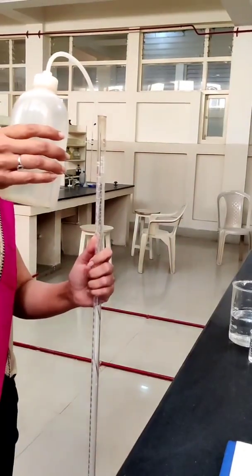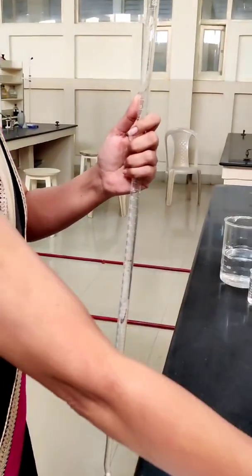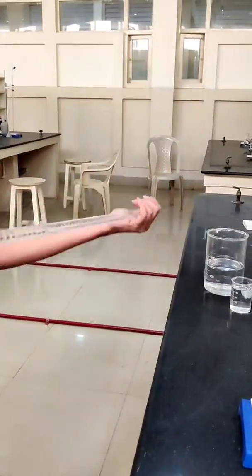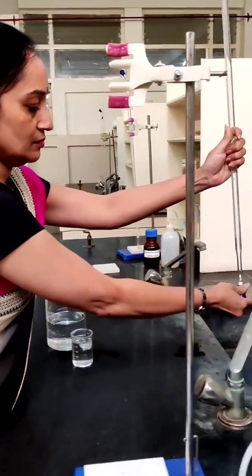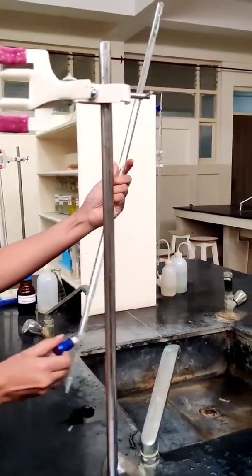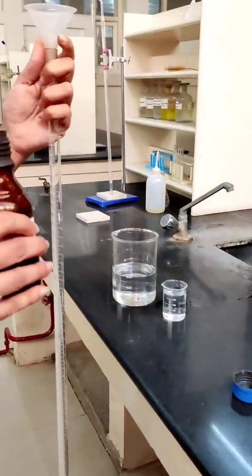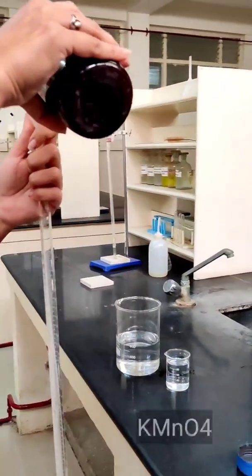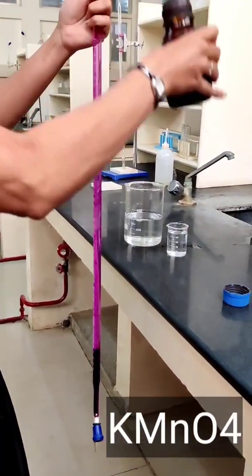To begin with, wash all the apparatus with water. Rinse the burette with the given KMnO4 solution and fill it with KMnO4 solution.